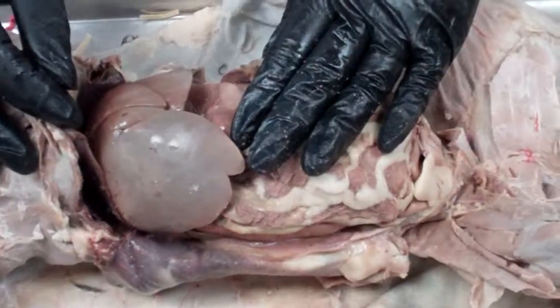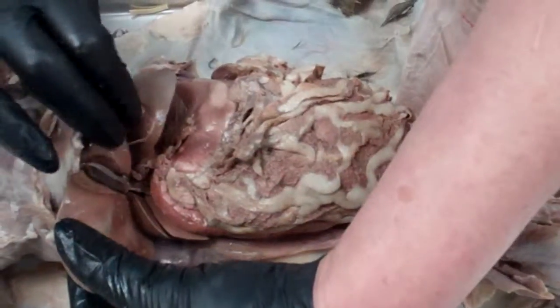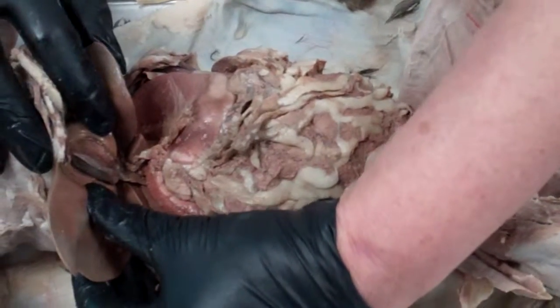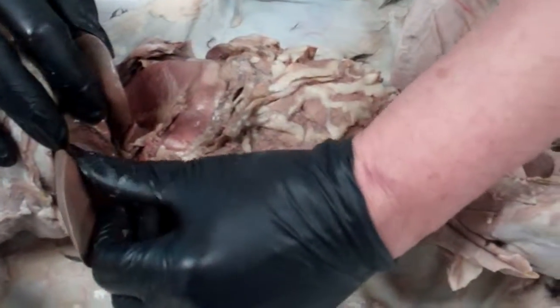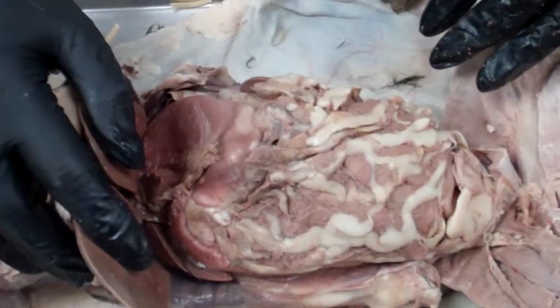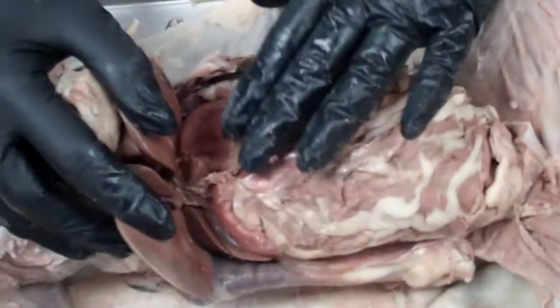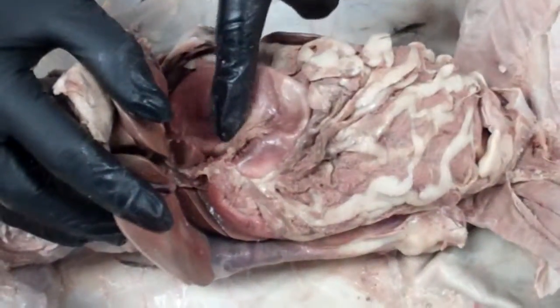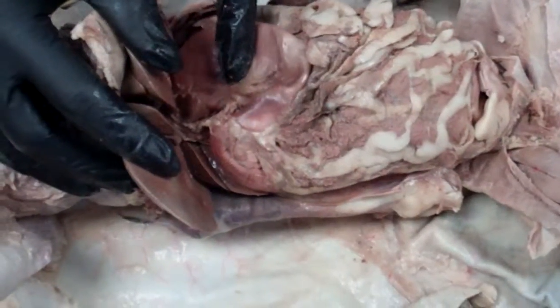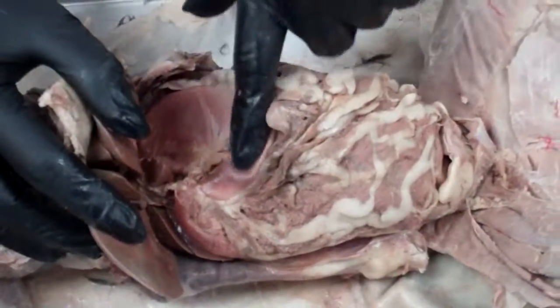When you look at the right medial lobe of the liver, you'll see it has kind of a crack in it. If you open that up and you look inside, that kind of brownish structure, sometimes it'll be real green because bile is green. This is the gallbladder, so we'll be finding the gallbladder. And then underneath the liver, the next structure as you come down is the stomach. And in the middle of the stomach is this fatty area right here. This is called the lesser omentum. And it's inside the curvature of the stomach. This whole thing right here is the stomach.